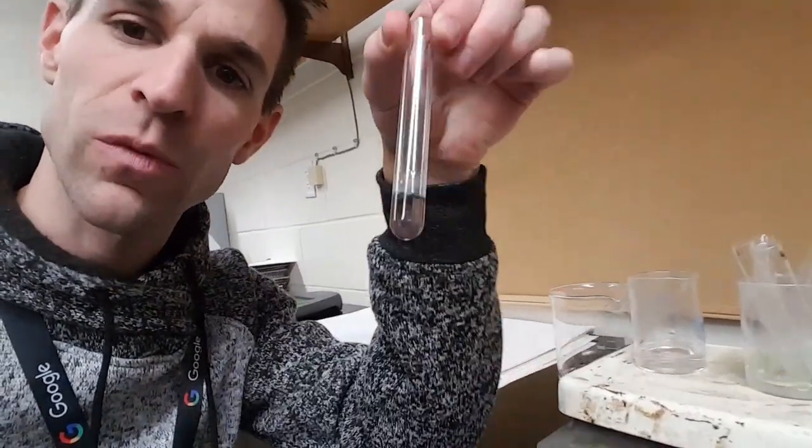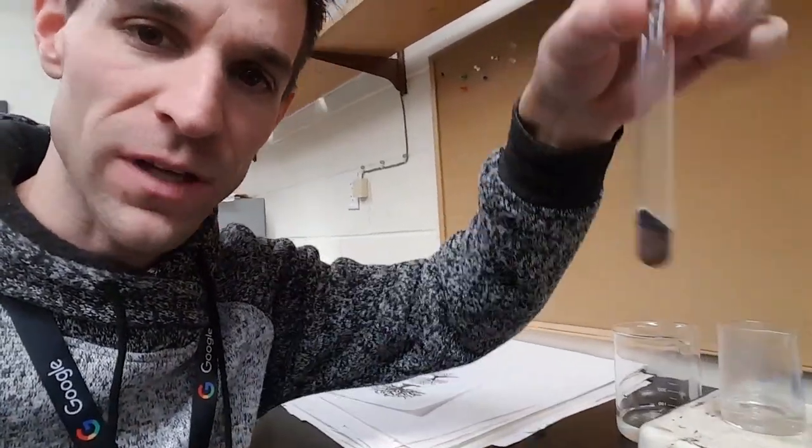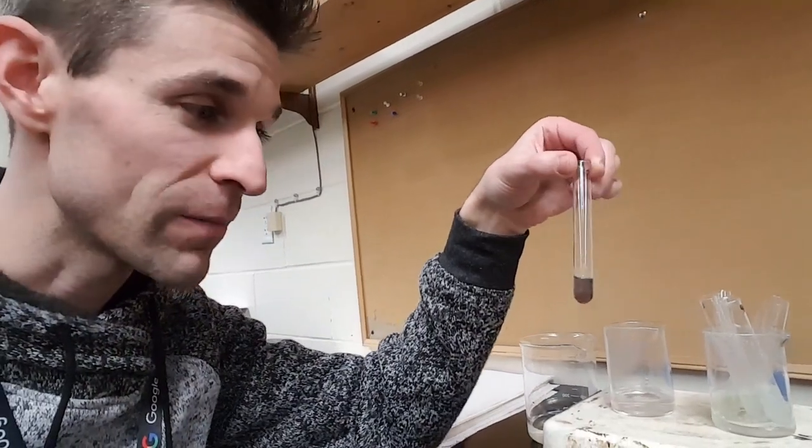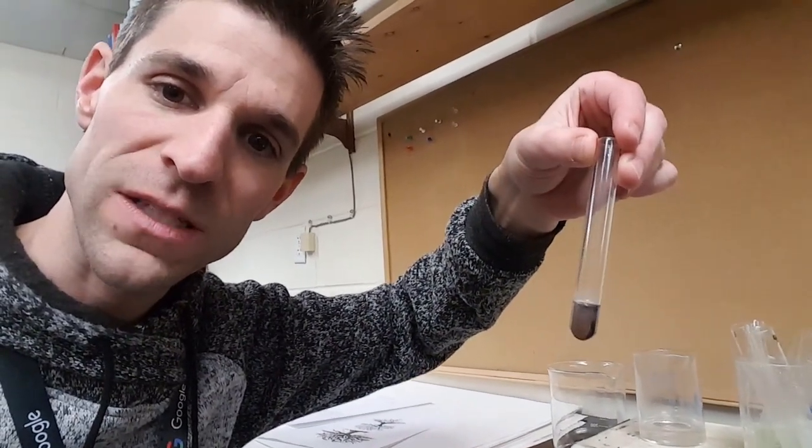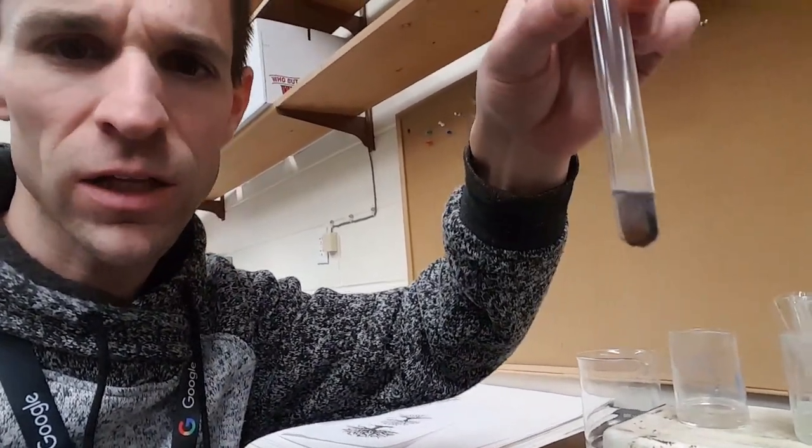Okay, we're back for the final time, I hope. And now here is our DNA sample from the banana. We isolated the DNA, and then we put the diphenyl amine in here, and then we boiled it for 10 minutes. This result is a little bit different than the results we had from the samples in class. Maybe the samples sat out in class just for a few more minutes than they should. But again, here's that dark color.